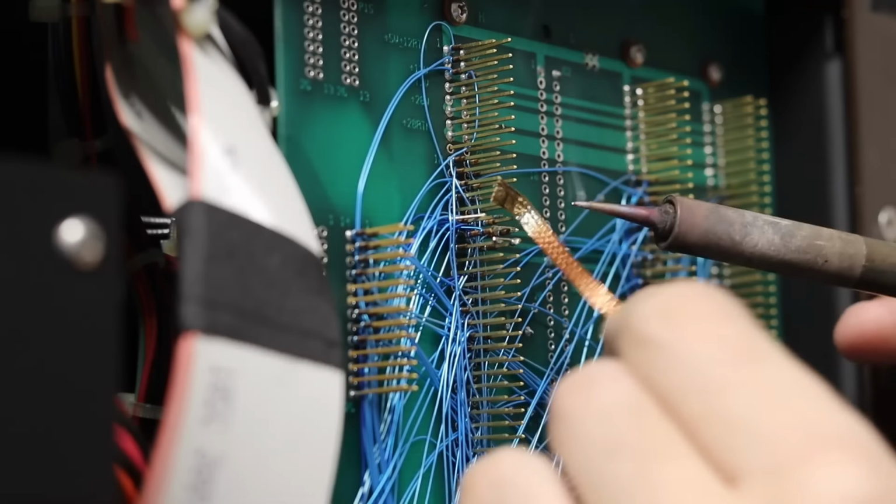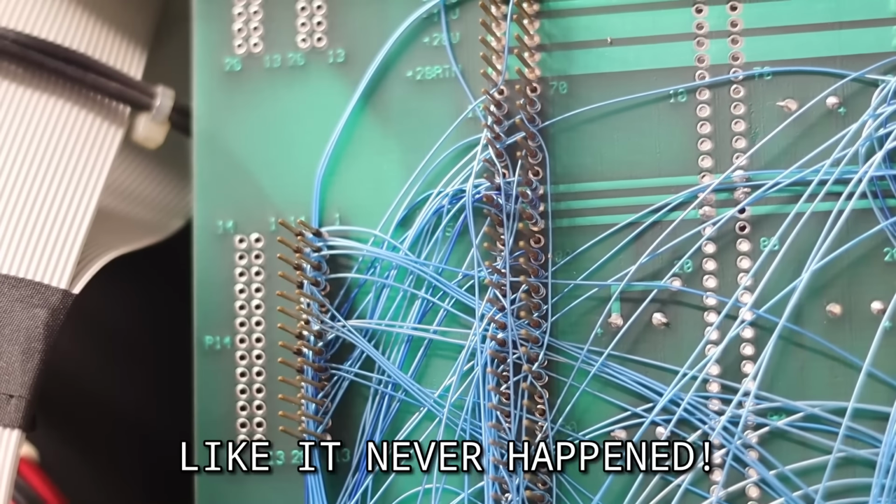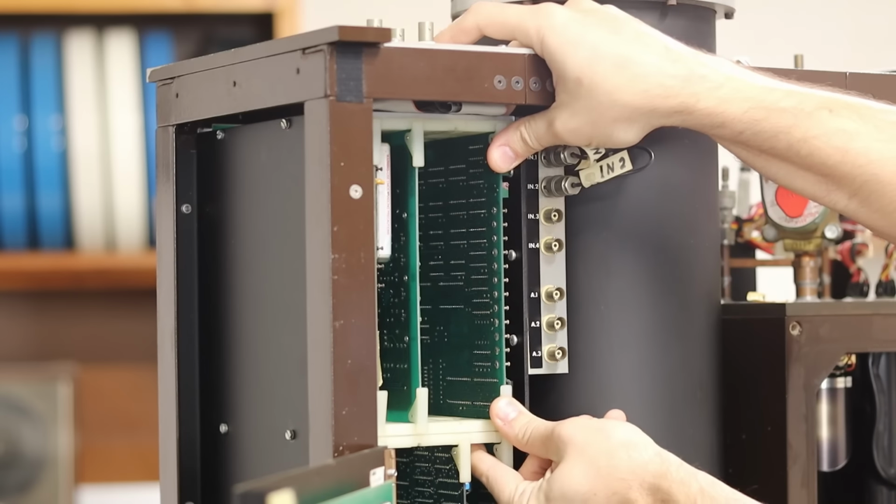And so I'm going to slot the card in, and I think I might actually remove this because I don't really like having things soldered to wire wrap pins. So we'll remove that, clean it up, slot the card in, and we should be good to go.